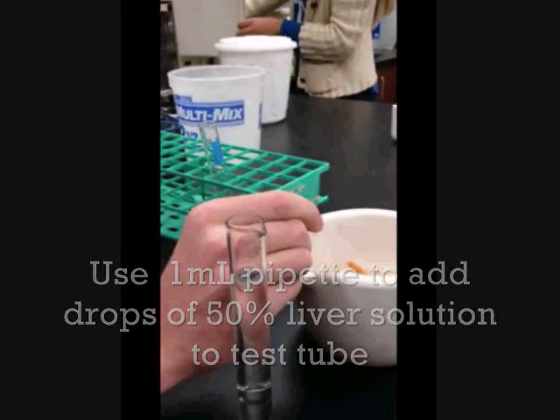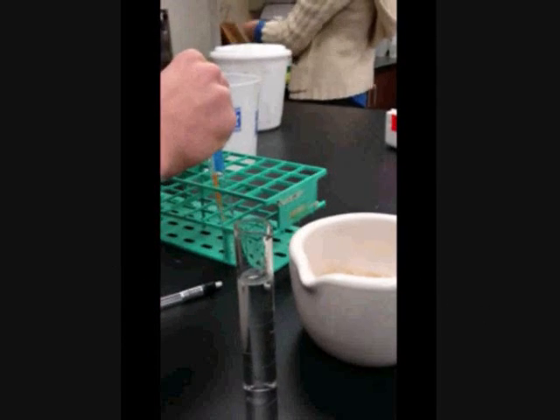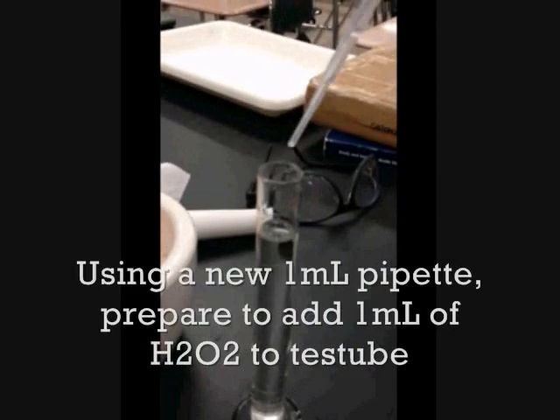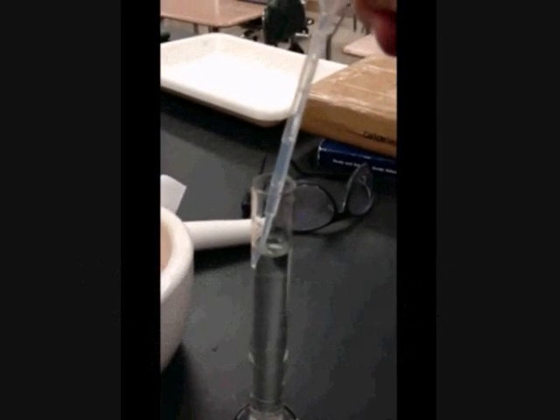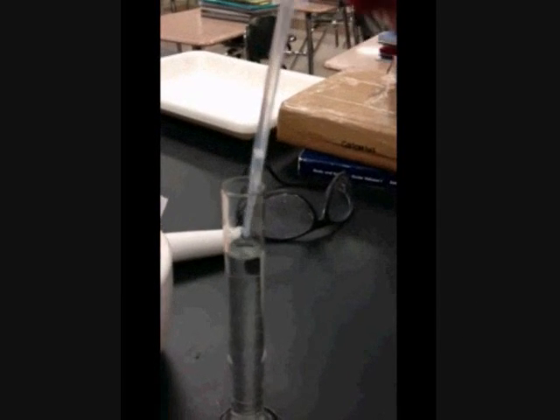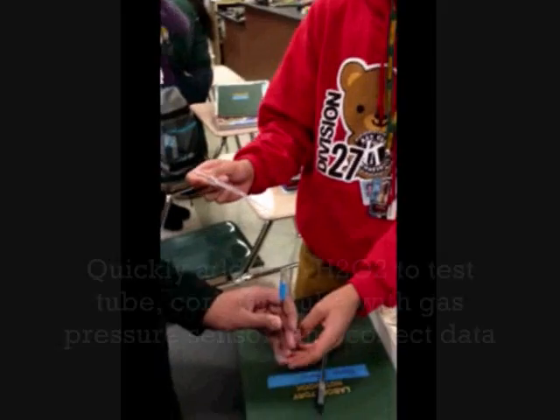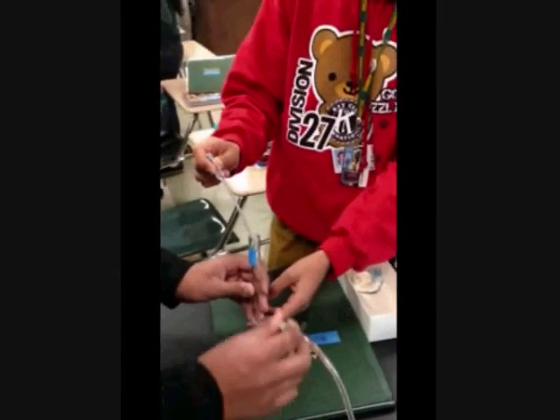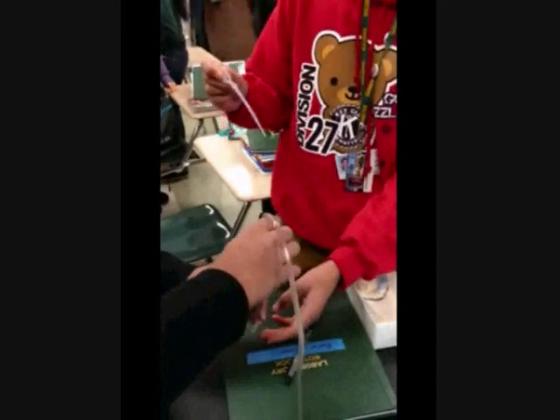Use a 1 milliliter pipette to add drops of 50% liver to test tube. Using a new 1 milliliter pipette, prepare to add 1 milliliter of hydrogen peroxide to test tube. Quickly add 1 milliliter of hydrogen peroxide to test tube, connect test tube with gas pressure sensor, and collect data.